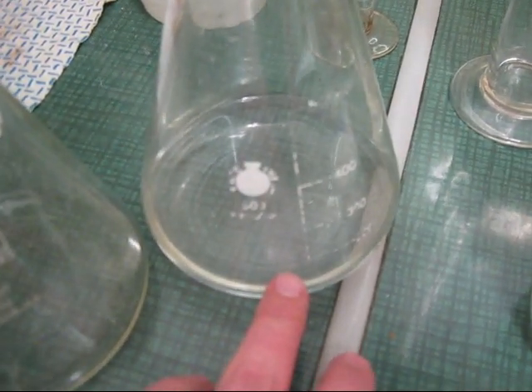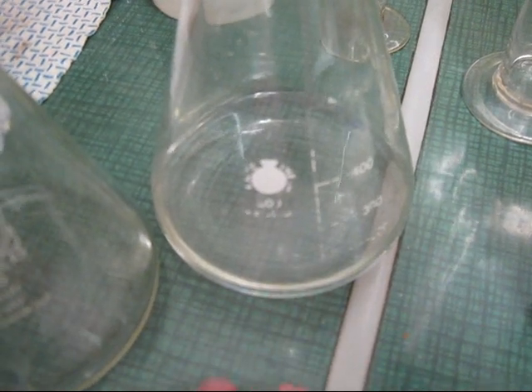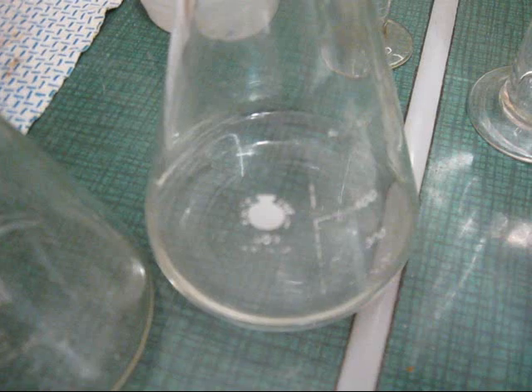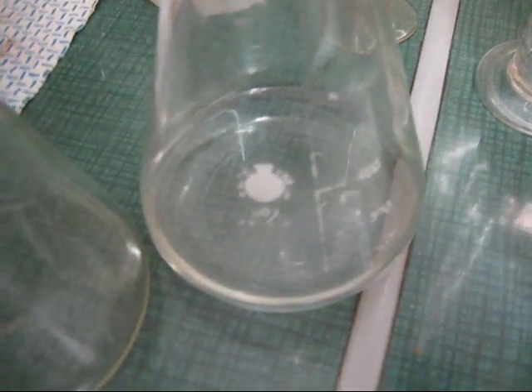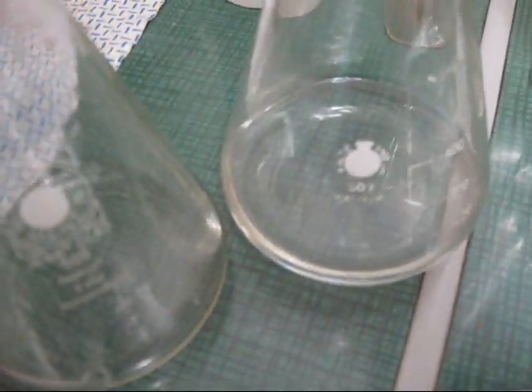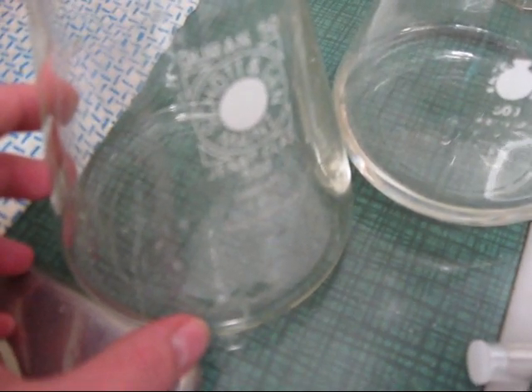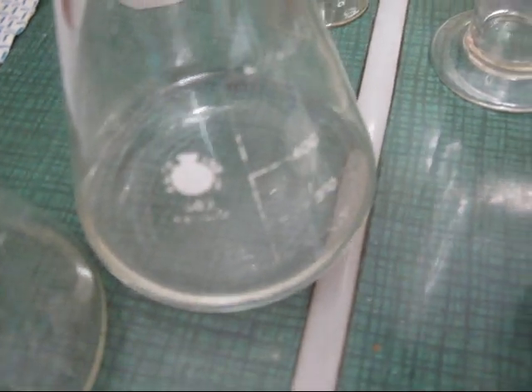Blood only contains a few cells that have DNA. That is the leukocytes. The erythrocytes, like the red blood cells, do not contain any DNA, only the white ones. But probably I couldn't break them up last time. So I will try the concentrated salt solution as well, probably break them up due to osmotic pressure. But maybe this one will work as well. I don't know yet.